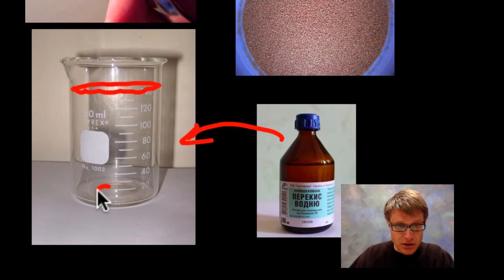We're going to put that little paper in, and it's going to sink down to the bottom. And so if there's no yeast on it, what's going to happen? Well, that filter paper is going to sit at the bottom forever. It will never float because there's no enzyme on it, there's no catalase on it to break that hydrogen peroxide into water and oxygen, so it'll sit there forever.